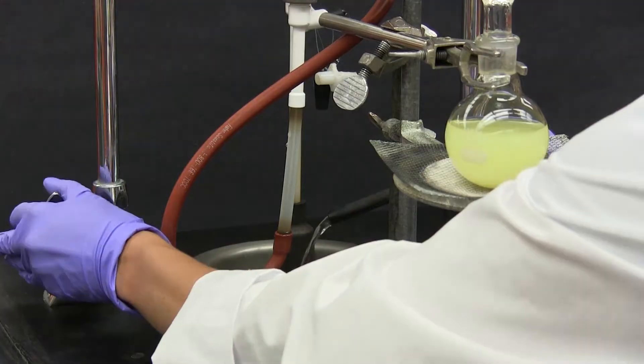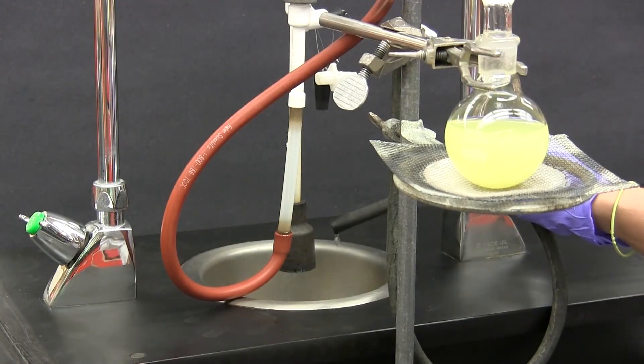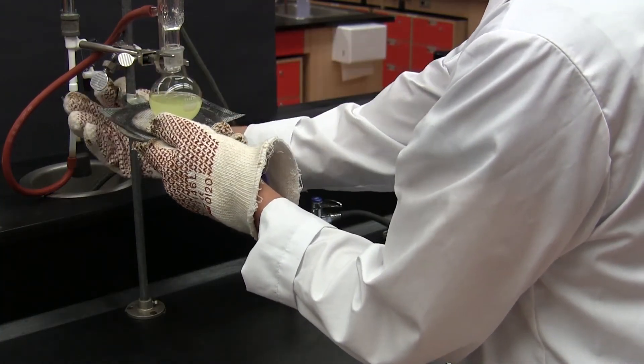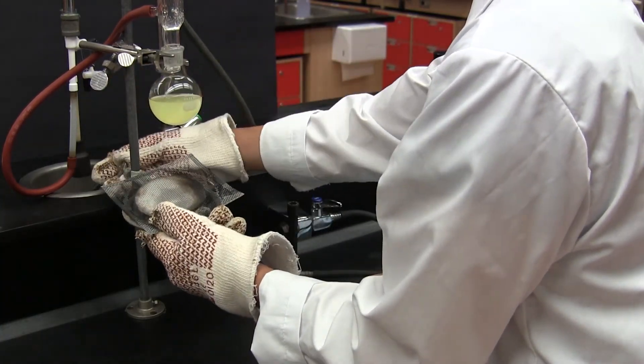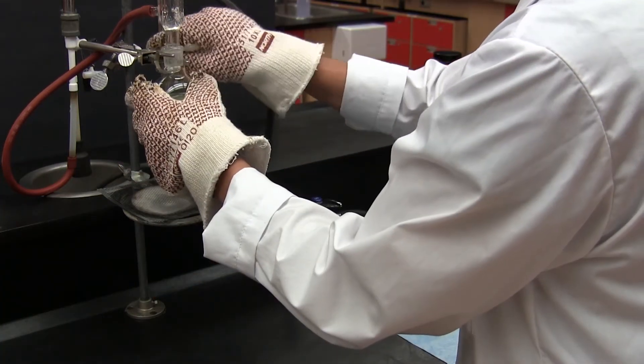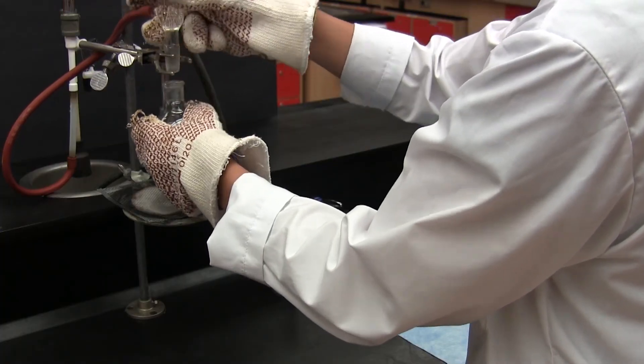When the reaction mixture is no longer boiling the water flow can be stopped. Take care when disassembling the apparatus because parts of it will be very hot. Be sure to either wear heat protecting gloves or wait several minutes until the apparatus can be safely handled without getting yourself burned.